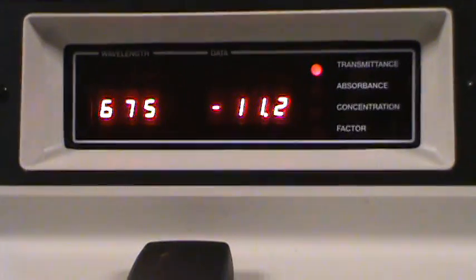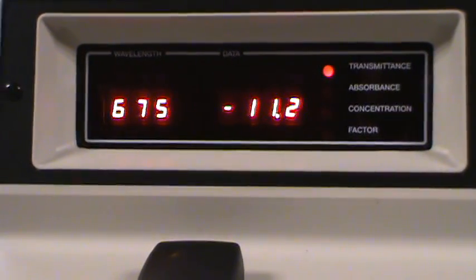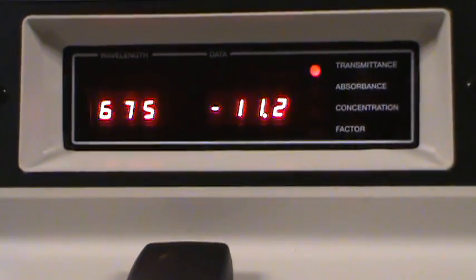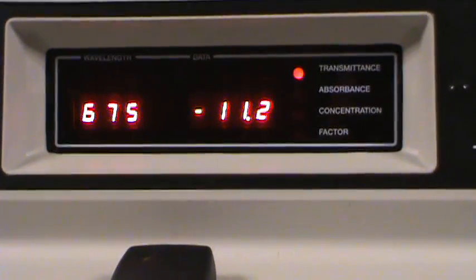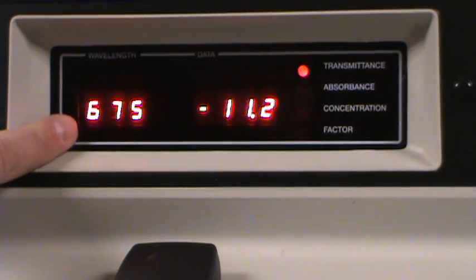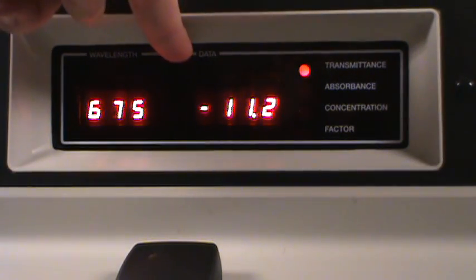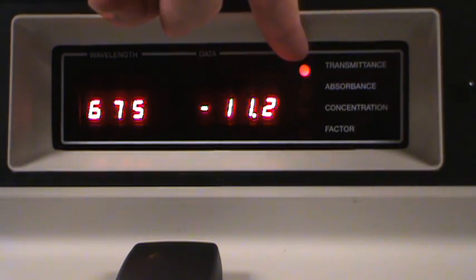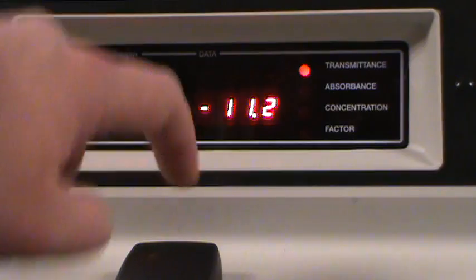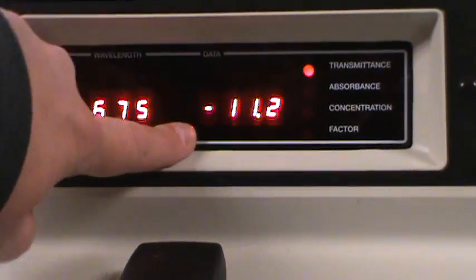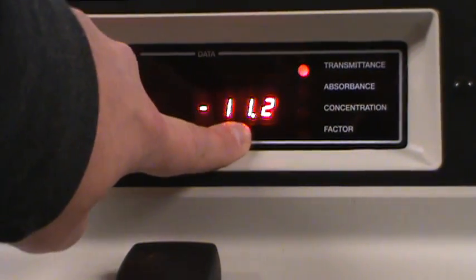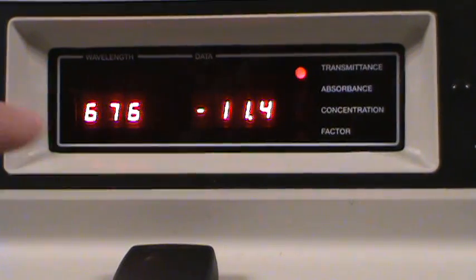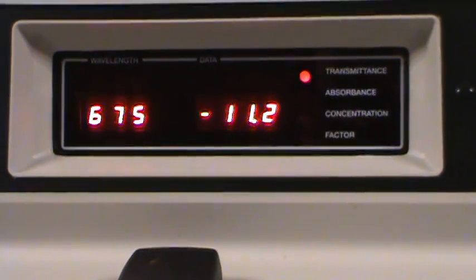If we move up and look at the display, pretty straightforward display. It's got a reading for wavelength and this one's called data. Right now it's reading transmittance. So right now the transmittance that's being observed by the detector is negative 11.2. What does that mean? Well we'll get to that in a minute.